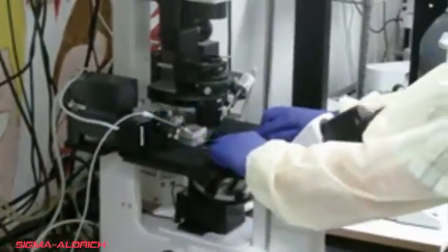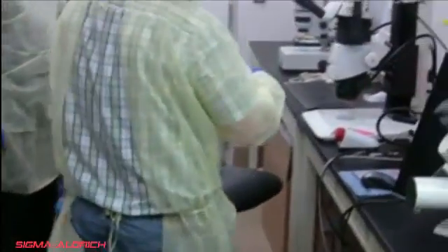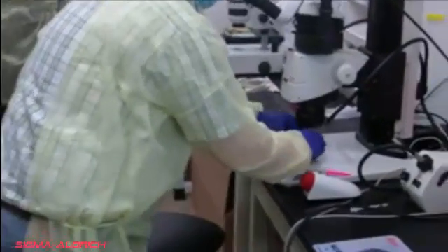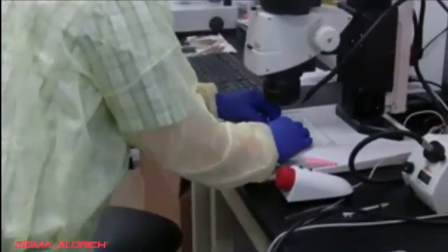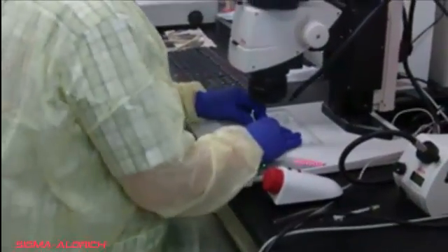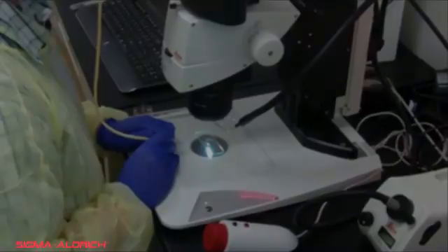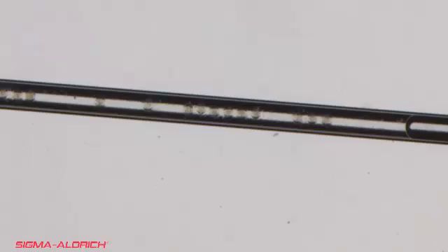When pronuclear injection is complete, transfer the embryos back to the dissection scope for transfer into anesthetized pseudopregnant recipient animals. If multiple slides will be injected, the embryos may be pooled into pre-equilibrated media drops overlaid with oil and held in the incubator until all embryos are injected. Begin the embryo transfer process by collecting the embryos to be transferred in a glass capillary tube.